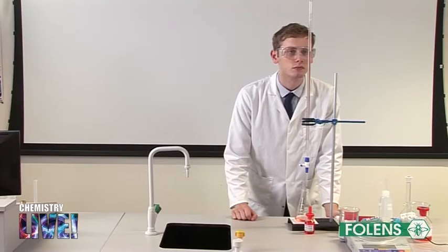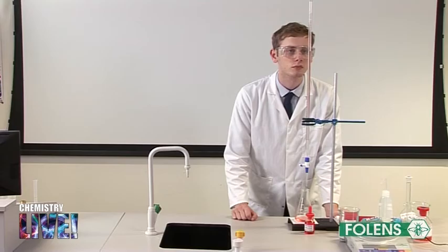The method of calculating the percentage of water of crystallization in hydrated sodium carbonate, washing soda, is shown in your textbook. This concludes the experiment.